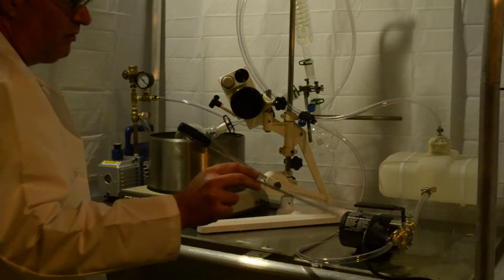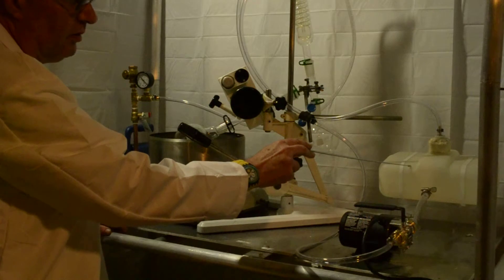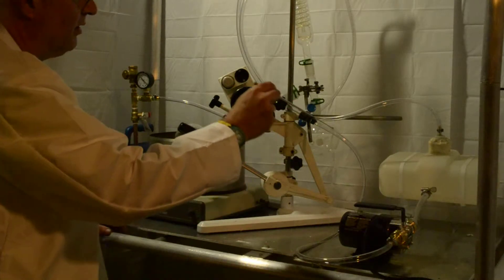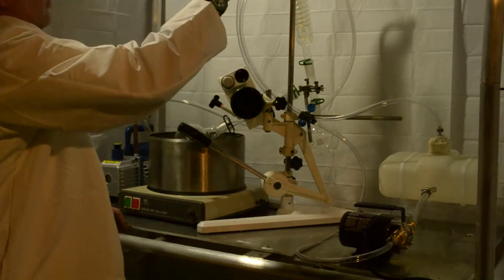This is going to come right out this way from your cooling tank, whatever you're putting in here to cool it with. It's going to come through here, come up this line right here and in.